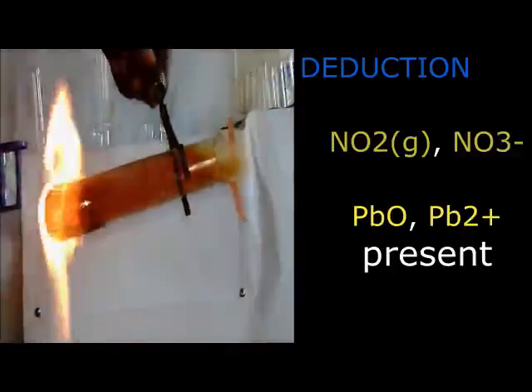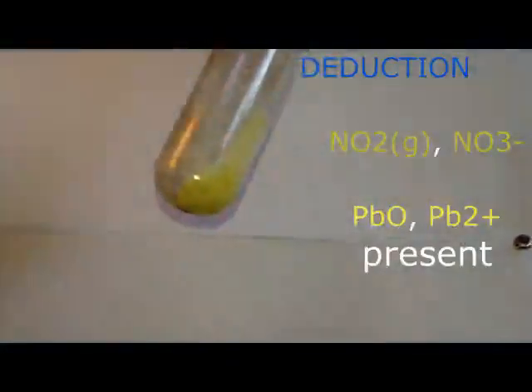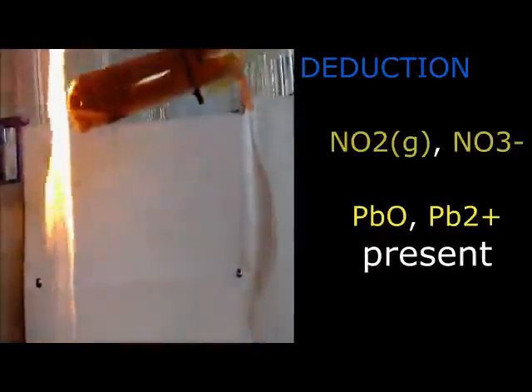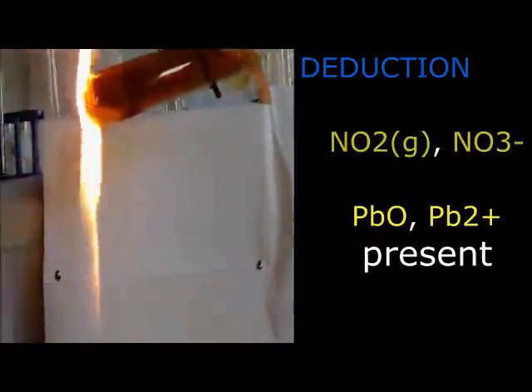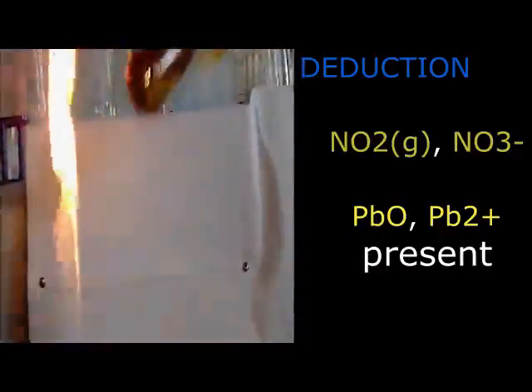So we had to eliminate the aluminium and zinc, and we continue with our lead downwards. So don't say the teacher told me everywhere I have to do zinc, aluminium, lead, and so on. It depends on the tests you are getting, which will guide you.